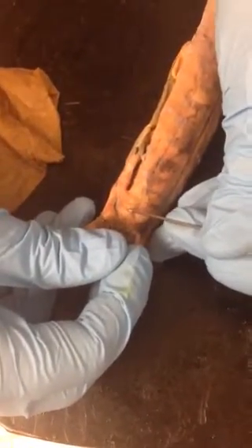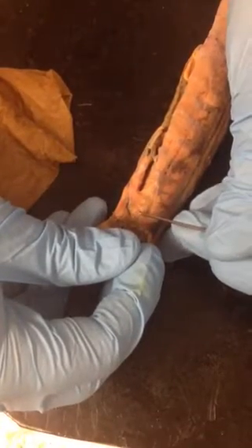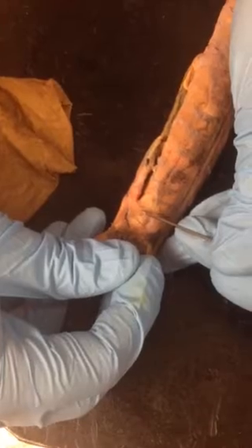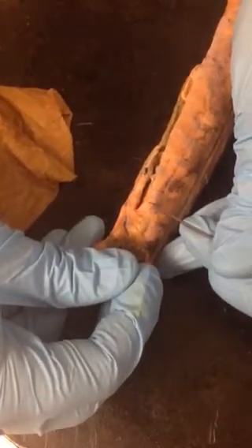Usually when I tag this on tests, I will simply cut the gills off and I will pin it very carefully. Here, this separation point right here, that is the dorsalis scapulae, followed by this down here, which is the latissimus dorsi. Some interesting things you can see from here.